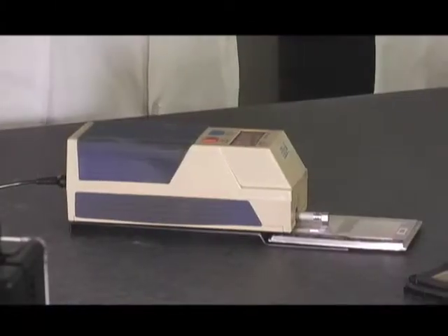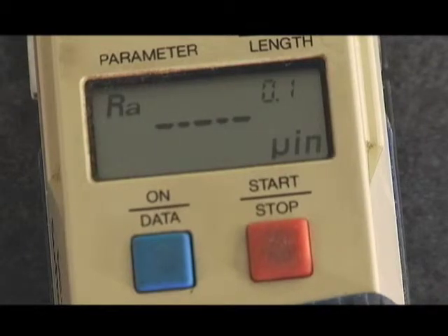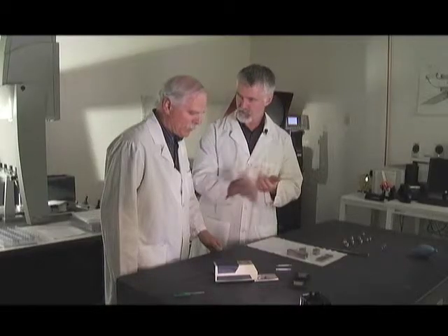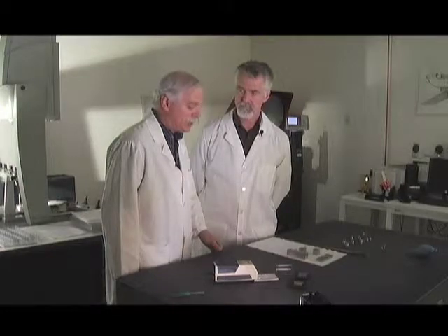Now we're in the lab with Craig Howell of CPM Labs and today we're going to look at what you call a profilometer — some call it surface roughness gauges. It measures the roughness of different metals depending on how they're machined or ground. Sometimes blueprints will call out a spec, usually roughness average, RA — this is the roughness of the surface produced by machining, grinding, or polishing, and there will be specific requirements of what it should measure.